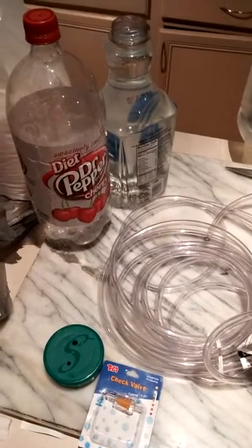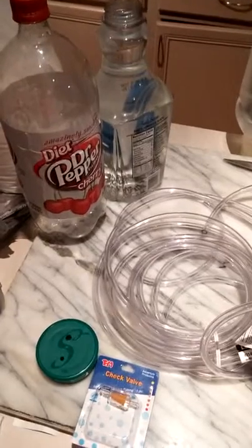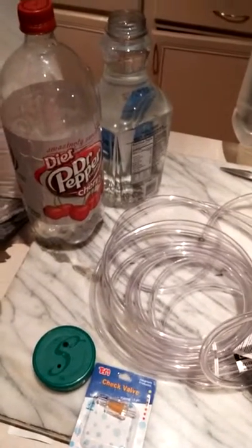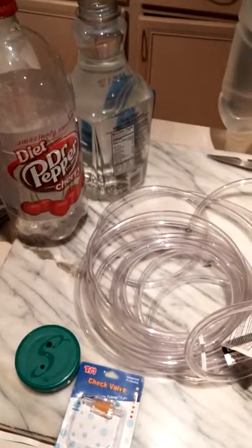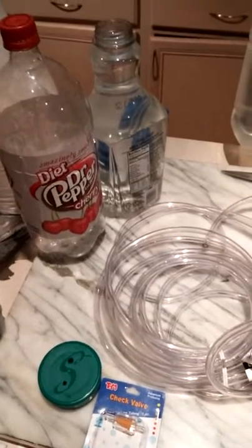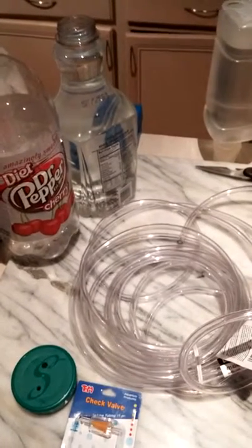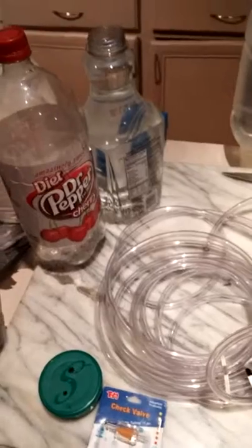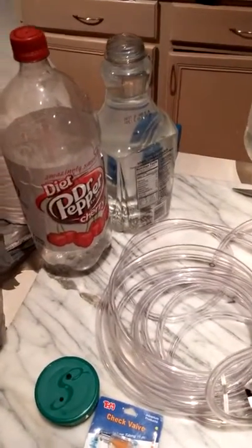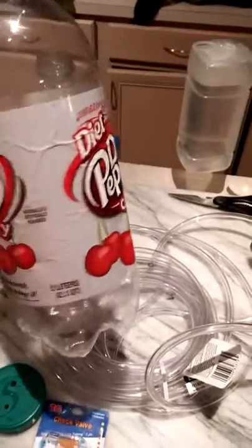I'm getting my setup ready for my phytoplankton cultures. The first step is getting all the containers ready. I'm currently waiting on the water to mix before I can continue, and I have the phytoplankton petri dishes ready — I'll show you those in a moment.